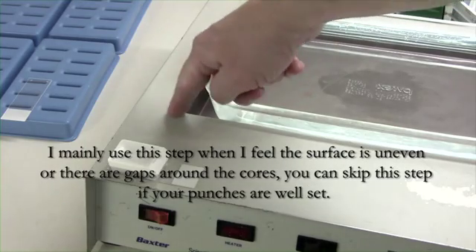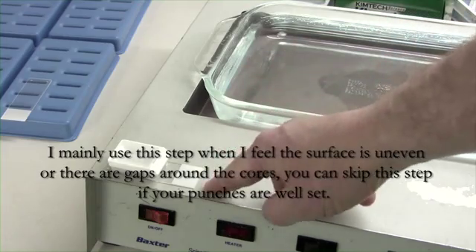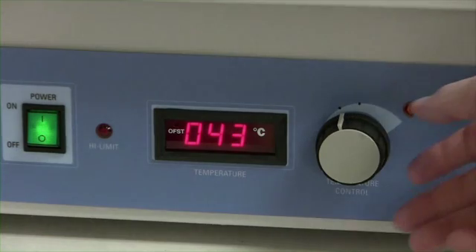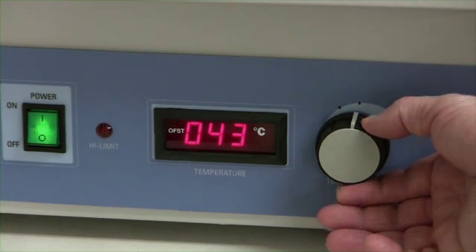Don't put the array block too close to the glass dish. This area is extremely hot and will definitely melt your array block. Please test this procedure with a blank paraffin block and slide if you are going to use it for yourself. It may not work for you with your water bath.